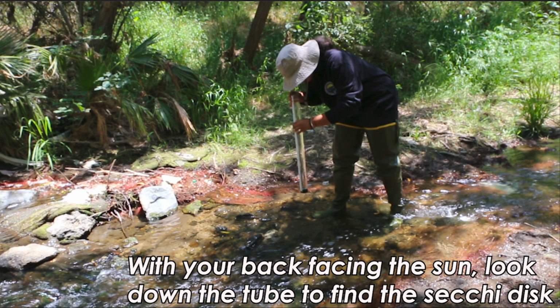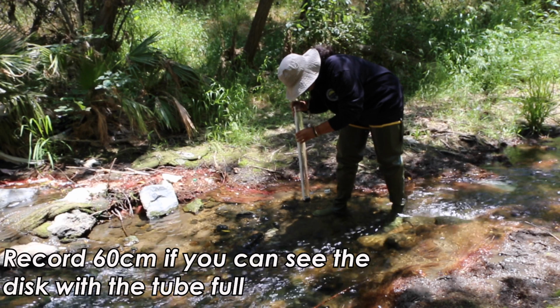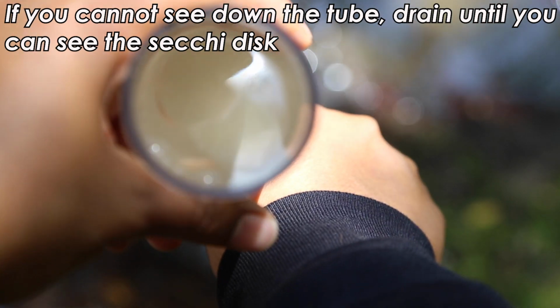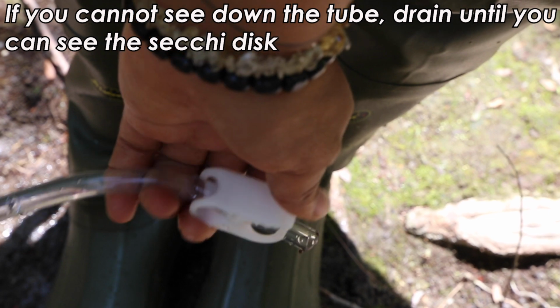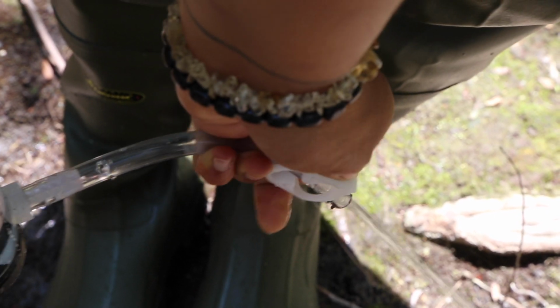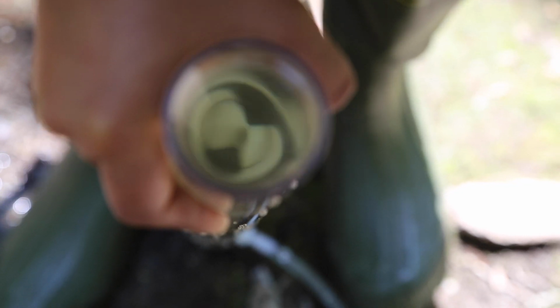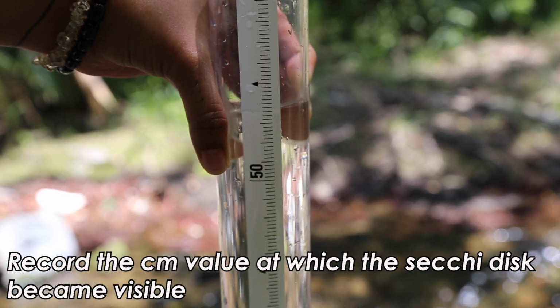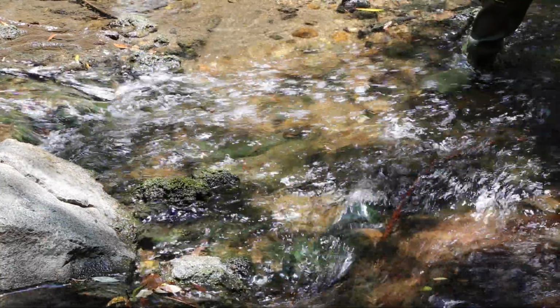Stand with your back to the sun to create shade for your transparency tube. Look straight down the opening of the tube. If the Secchi disc is visible, record 60 centimeters on your data sheet as the water level. If it is not visible, slowly and partially open the clamp to drain the sample until the Secchi disc faintly appears. At this time, you can close the clamp. This will be the depth of your water clarity. Read the scale on the side of the transparency tube and record the level on your data sheet in centimeters. Again, you may want to practice a few times before recording your values.